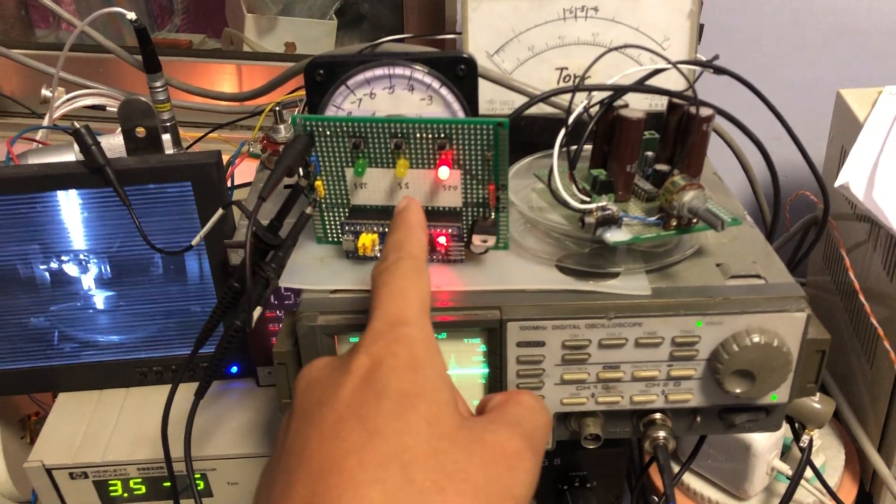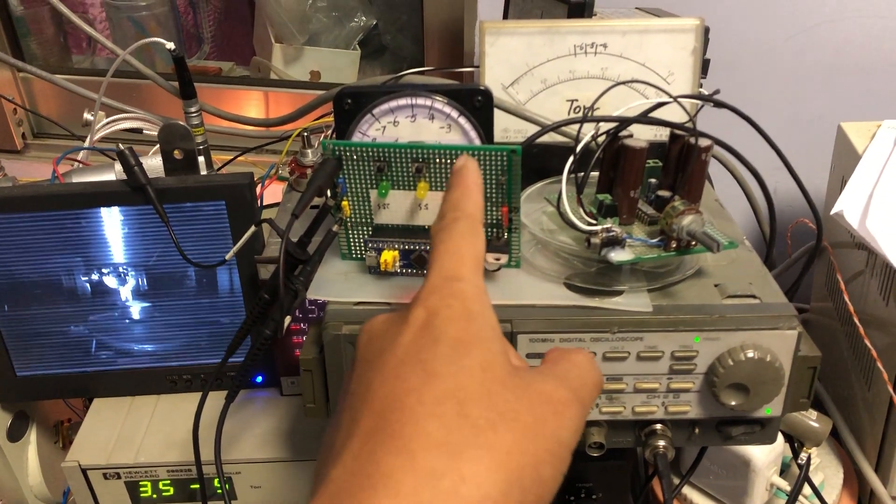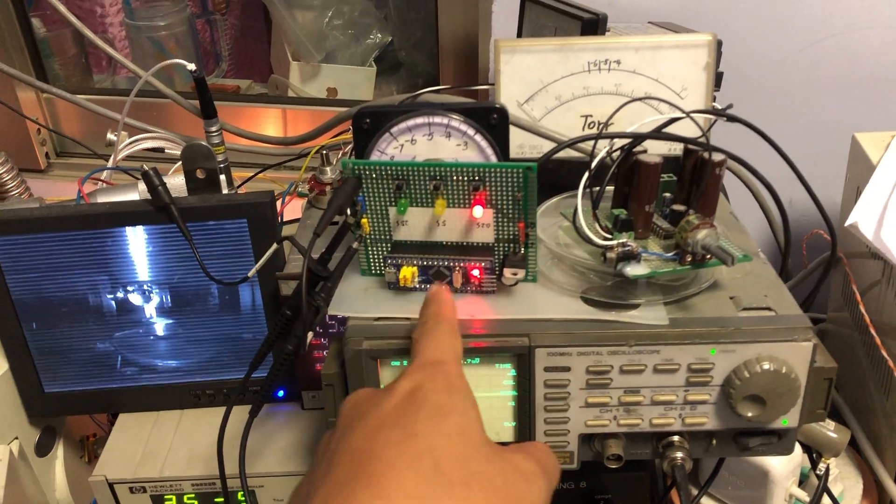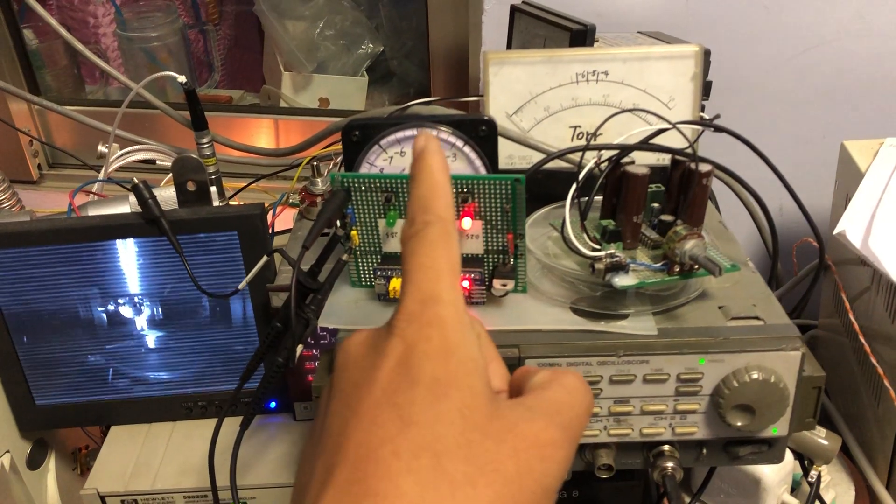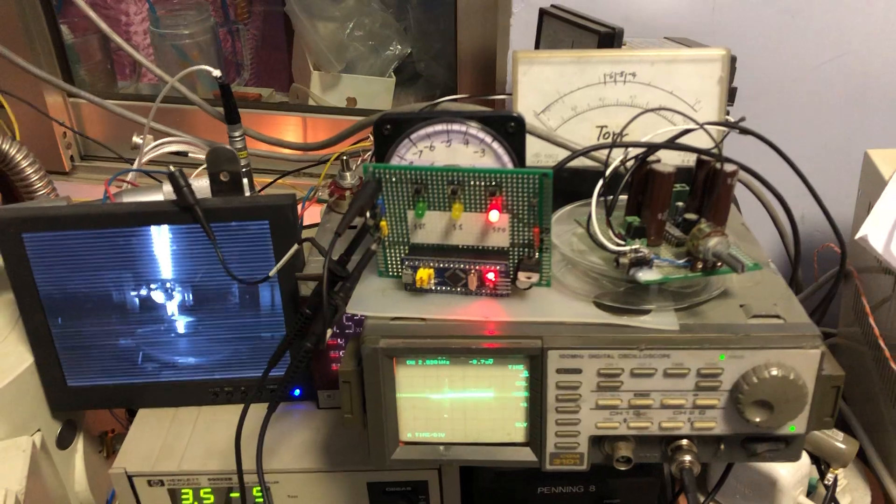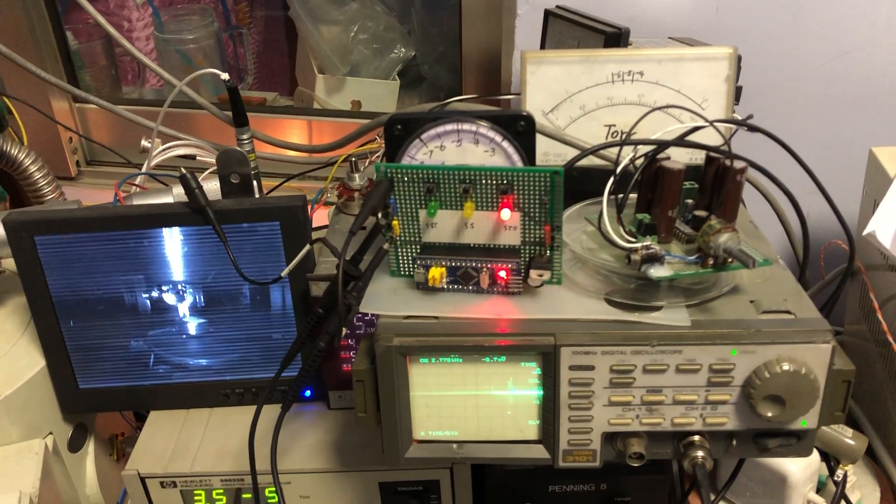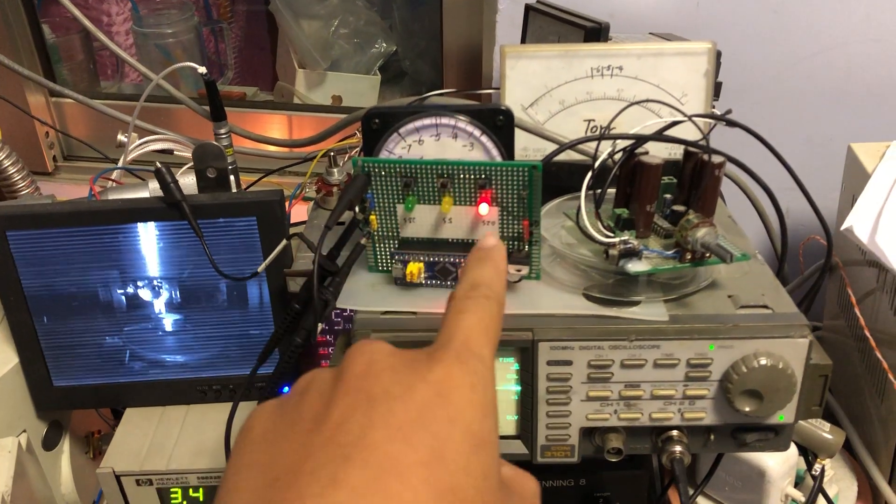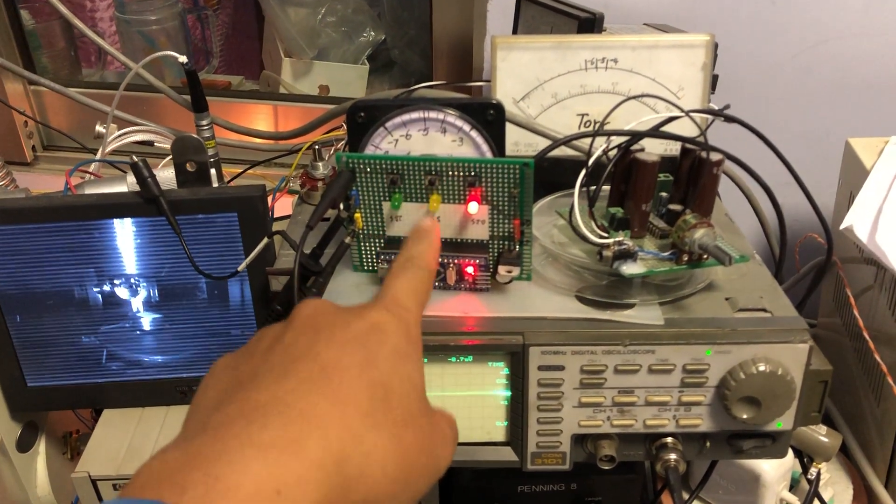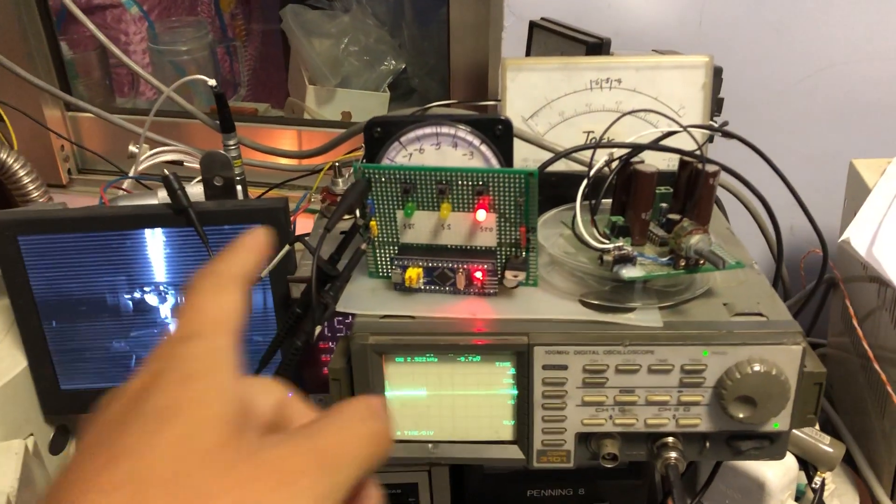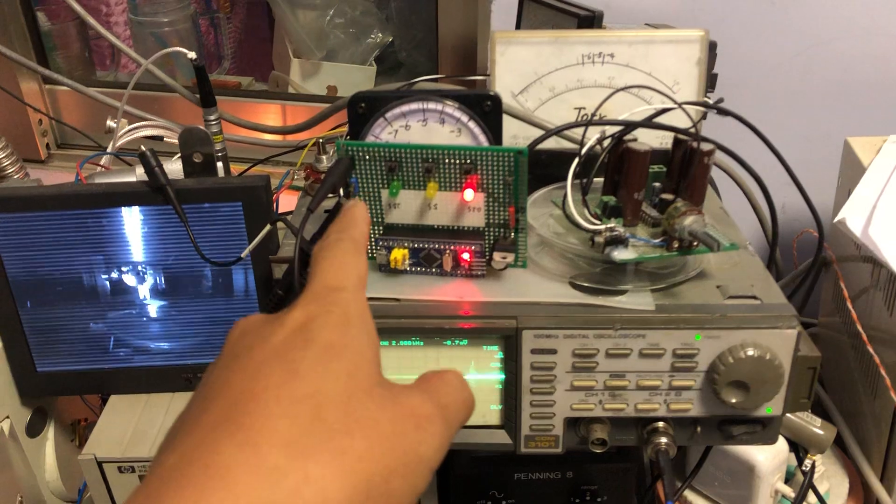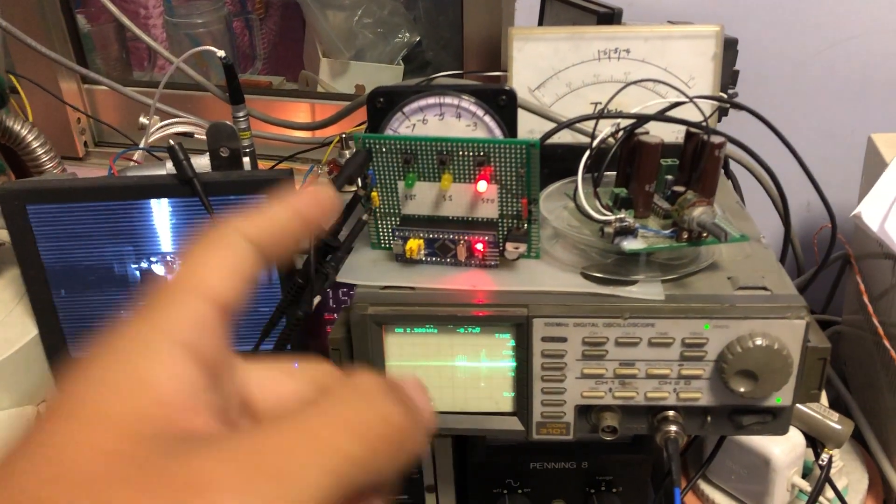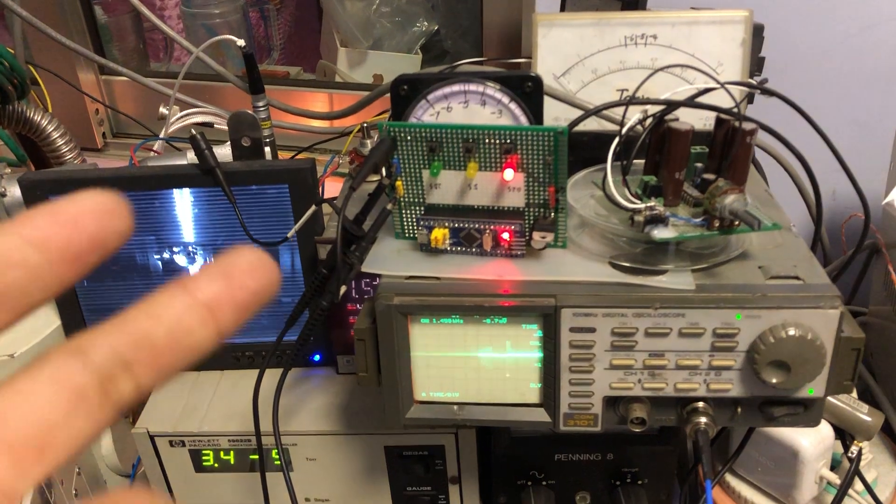Three levels to select: first the TV mode, slow mode, and picture mode. In TV mode is probably around 10 frames per second. Here is about five seconds per frame. And the lowest speed is about 25 seconds per frame.